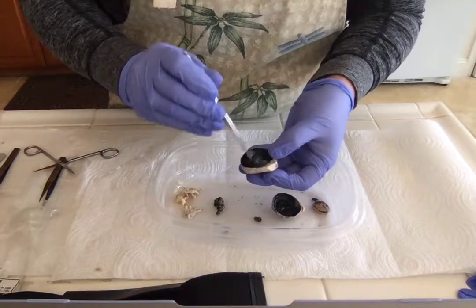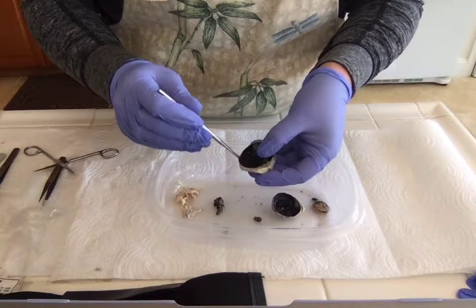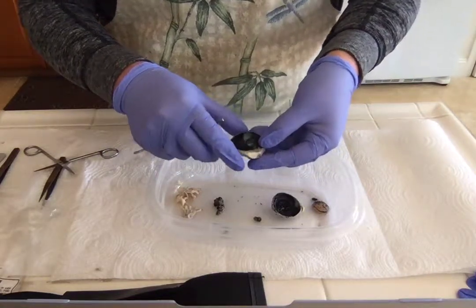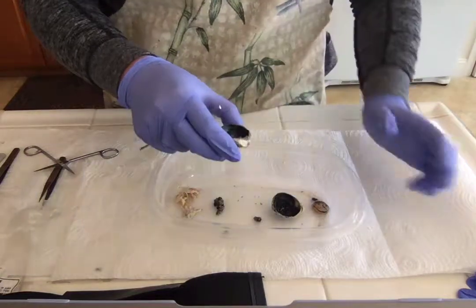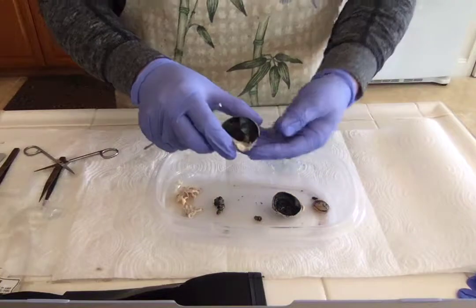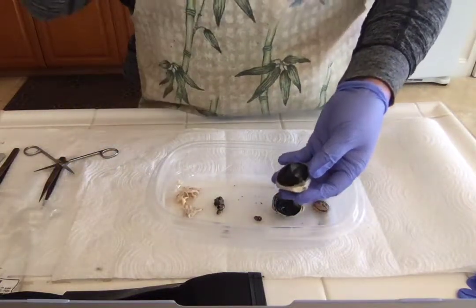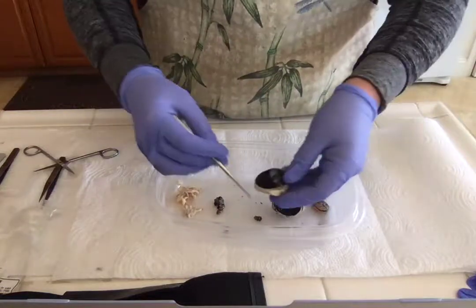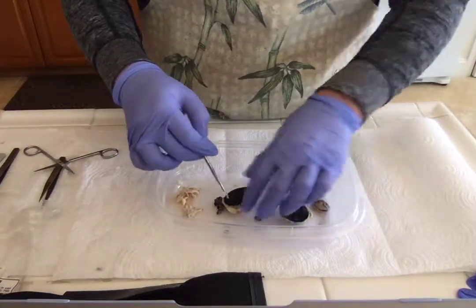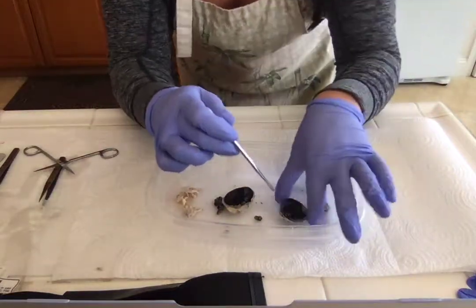And then if we get rid of the choroid, we see the very posterior of the eye, which is, this whole thing is the sclera. And what was interesting about the sclera is if you move it, it still retains its shape. So although the aqueous humor is responsible for keeping the shape of, let's see, this outer part right here, the sclera is what holds that circular shape of the eye.